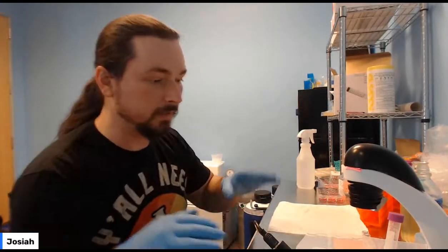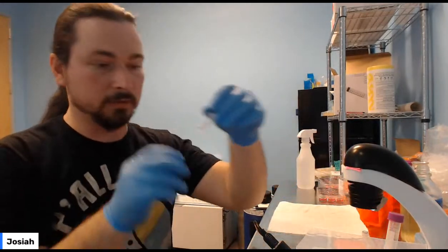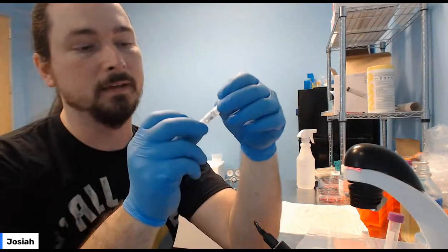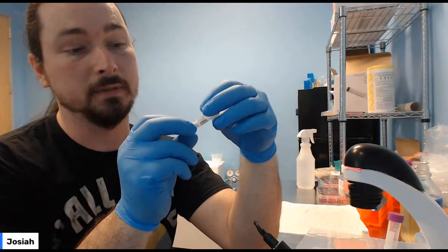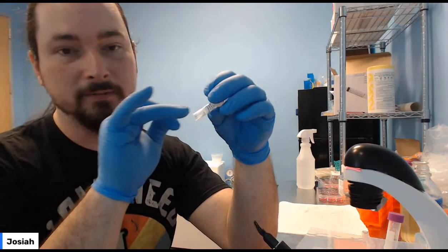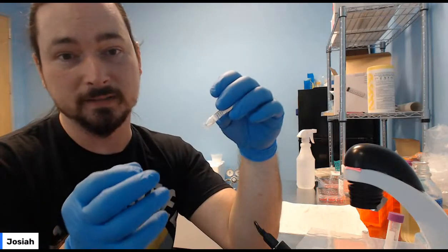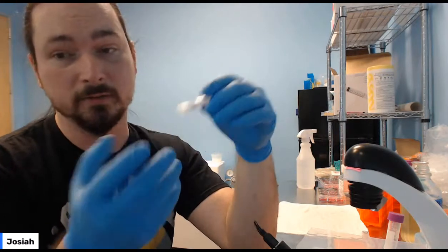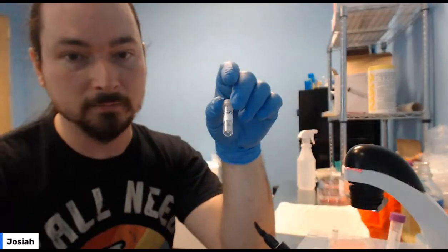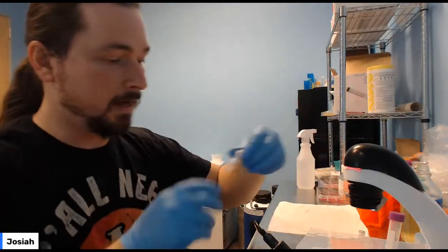What we're going to do is start prepping for the genetic modification. Now, that's pretty easy. You're going to need your lac-Z plasmid, which should come in a little tube. It's freeze-dried, so it should look empty. If you look carefully, you might see a kind of yellow string-looking thing stuck to the sidewall, and that's because it's freeze-dried, so there's no water in it and nothing to really see. You'll also get a sterile water tube, and this will just have water in it.